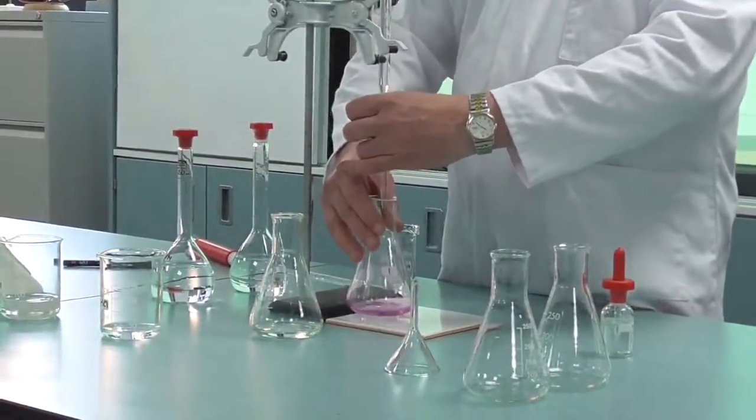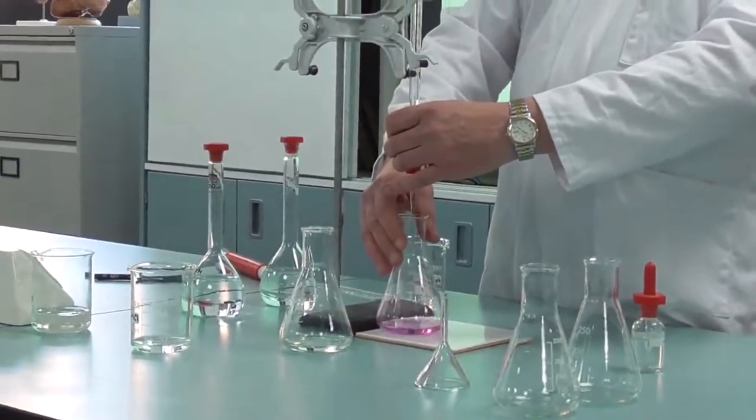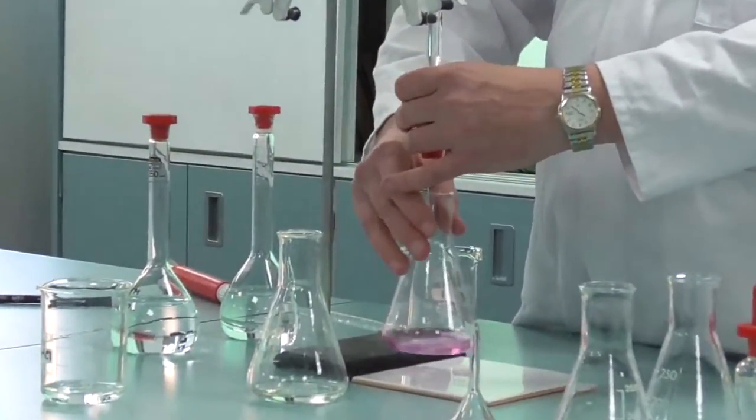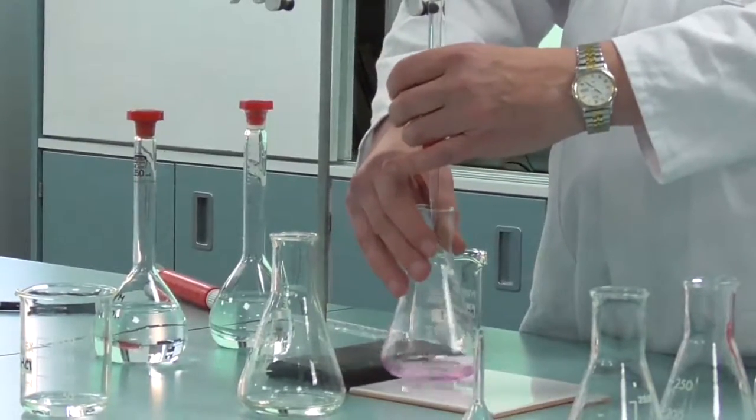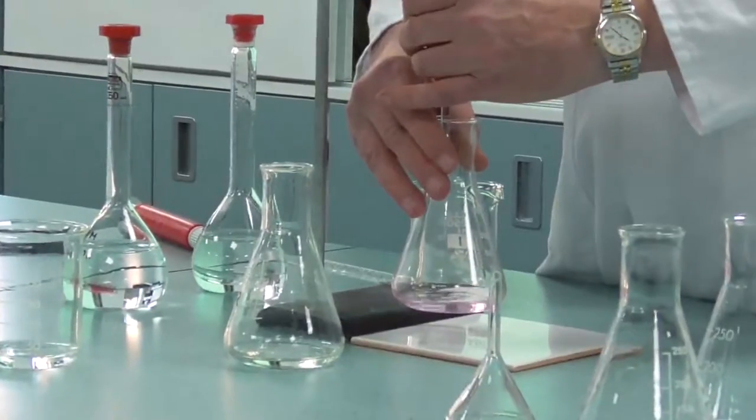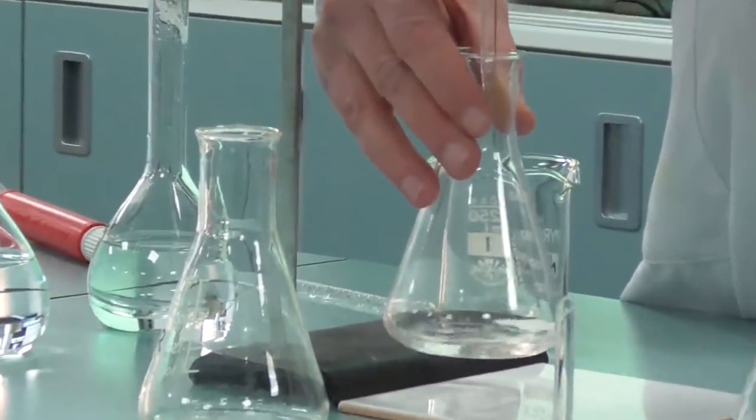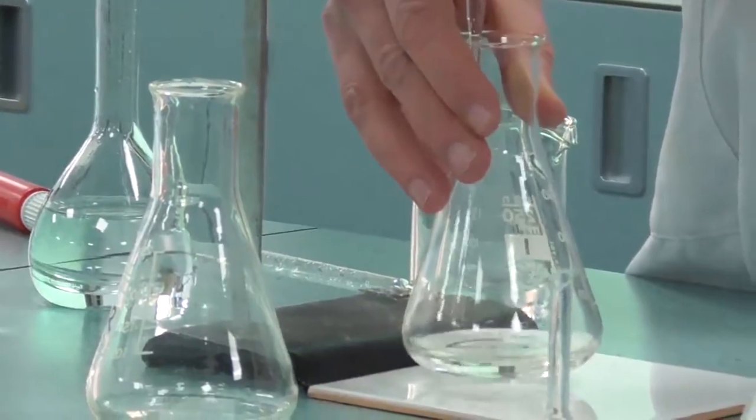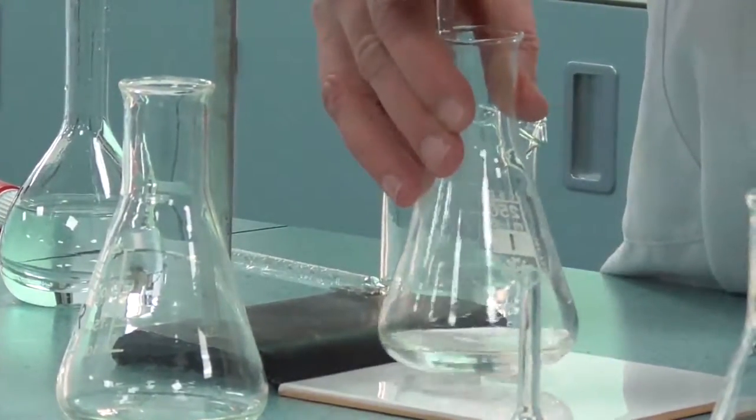I'm taking a careful eye, looking at it. Very close now. Now we just do it drop by drop. Still a slight tinge, and therefore it's changed. So let's turn it off.